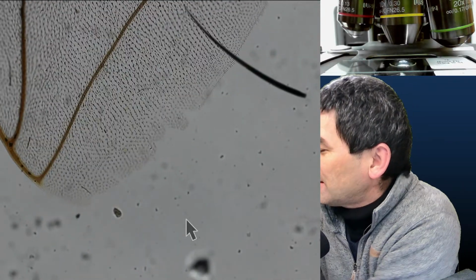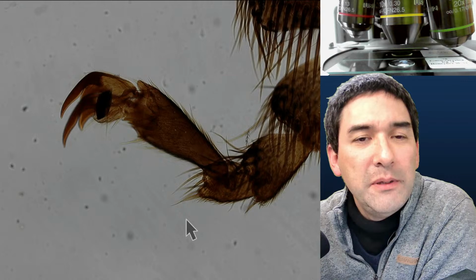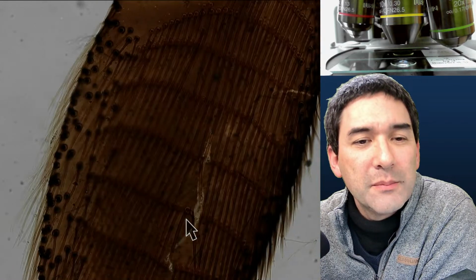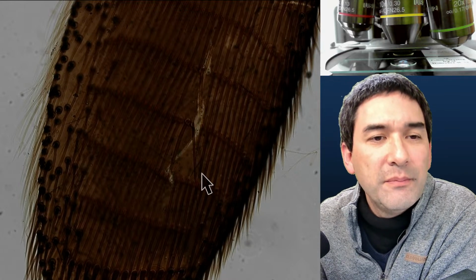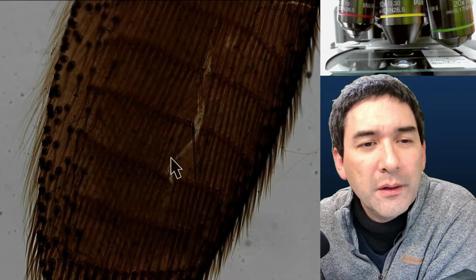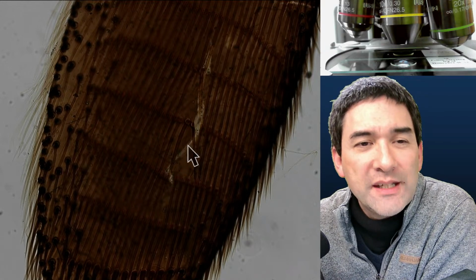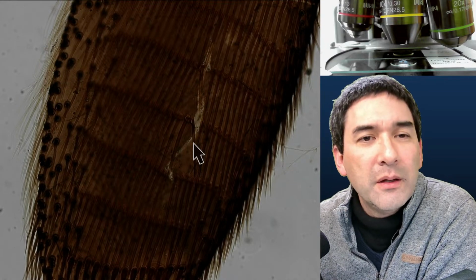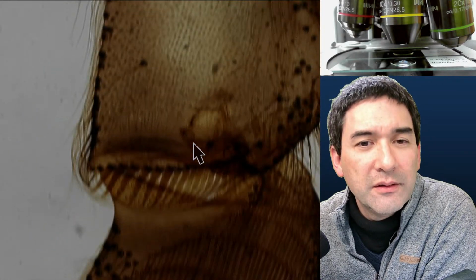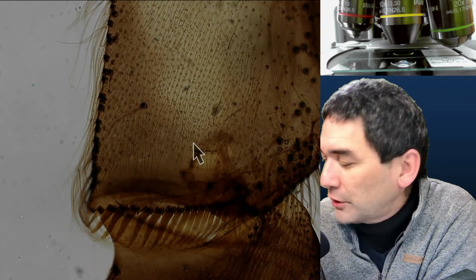So this is now from, look at this. That's a honeybee leg. That's a pretty huge one. Evidently, look here as well. You can see that the specimen is cracked open, which I do not consider such a big problem because it's actually a sign that it was compressed flat. You have to make sure it's kind of flat. So those tears and rips in the specimen are basically preparation artifacts.